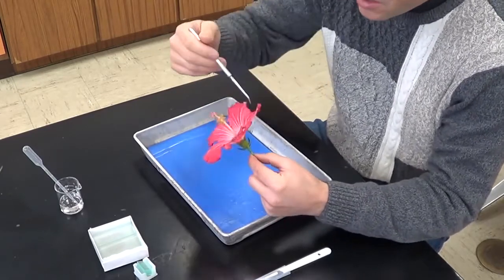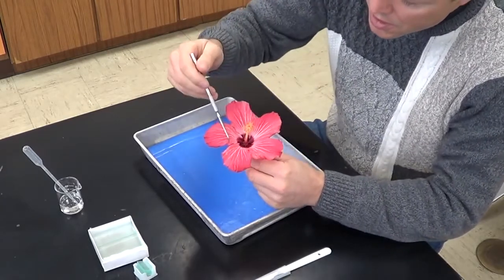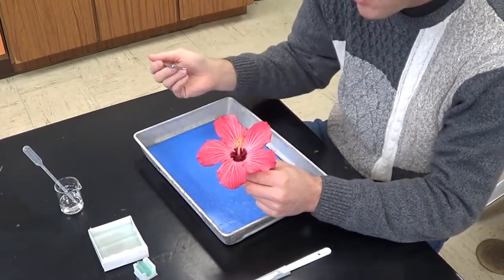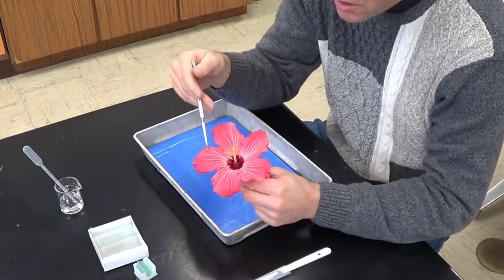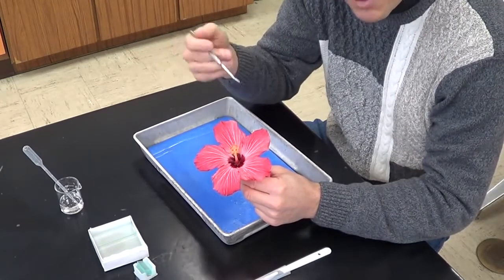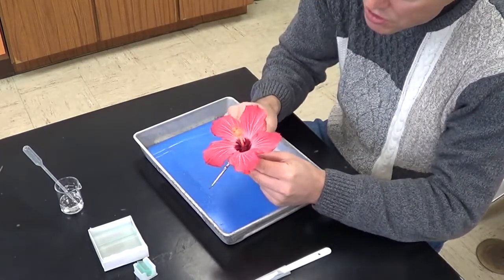Now the next whorl here, the next set of leaves, are going to be the petals, with a T, petals. And we've got 1, 2, 3, 4, 5 petals. Now again, these petals are modified leaves. They have a color, they have a scent, and they are very specialized for attracting specific pollinators to this flower.